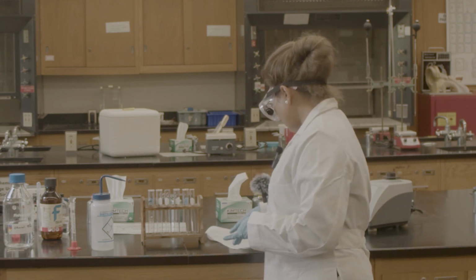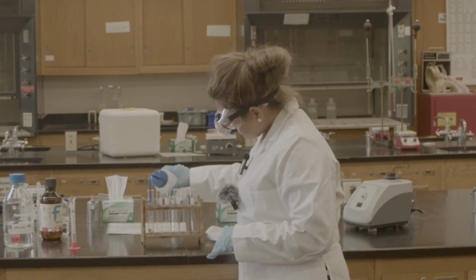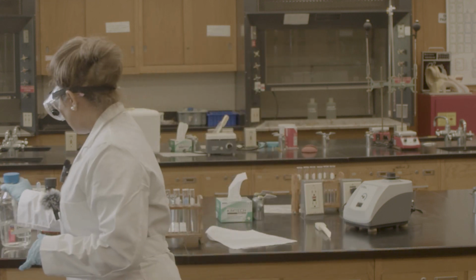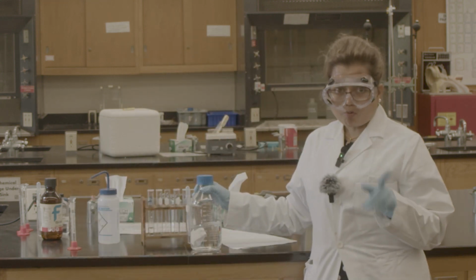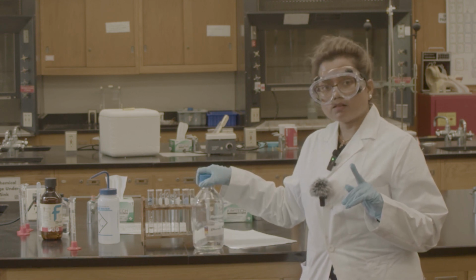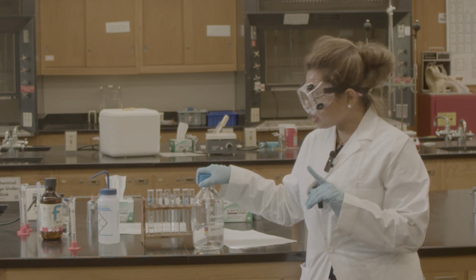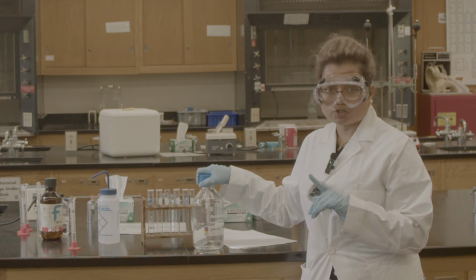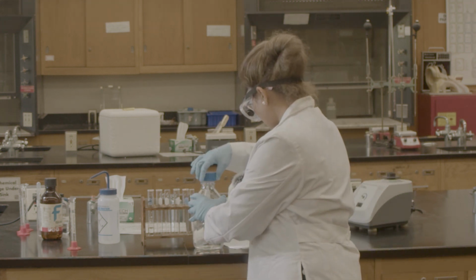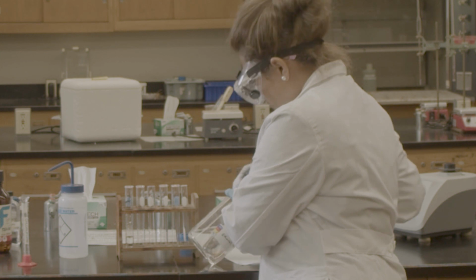So the first thing, it says water with alcohol. So I have water with the alcohol. We know that water is polar, okay? And for the alcohol, I'm going to use ethanol, which has the OH group. So both have a partially negative charge and a partially positive charge. So I'm expecting there should not be any layer, and it should be soluble because, in the presence of the OH group, they are making a hydrogen bond.